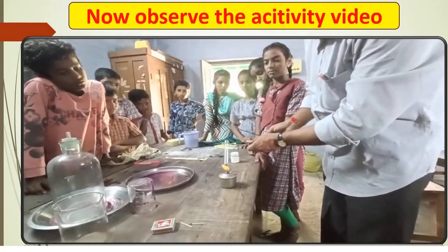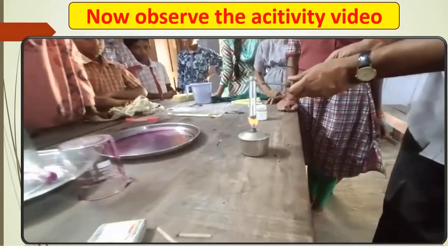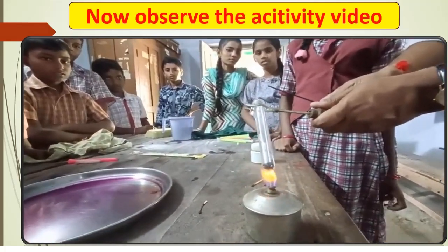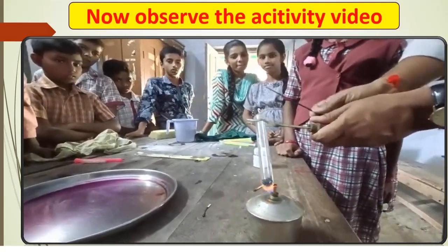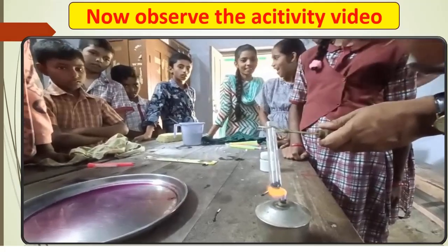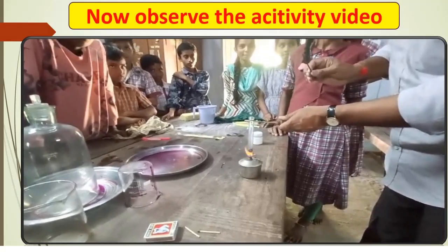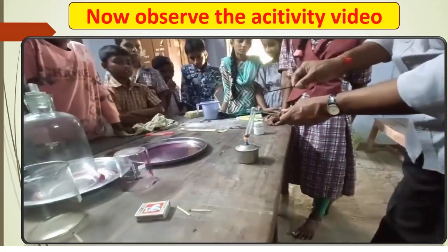Carefully hold the test tube with the test tube holder and heat over the flame of the spirit lamp. Here we get some sound while heating potassium permanganate on the flame of the spirit lamp. Here we observe a gas is released on heating.